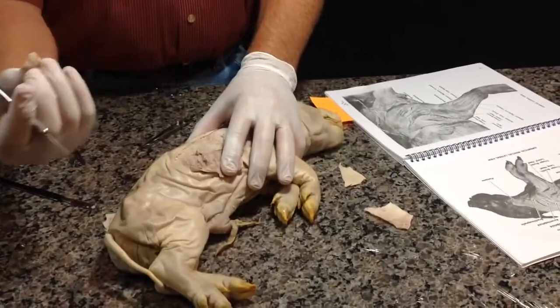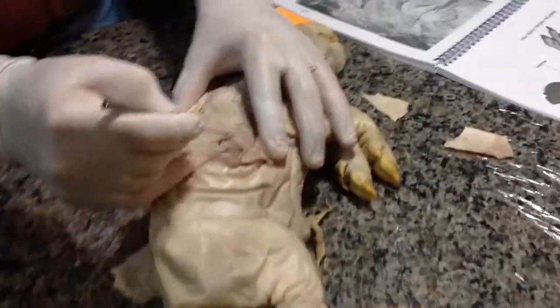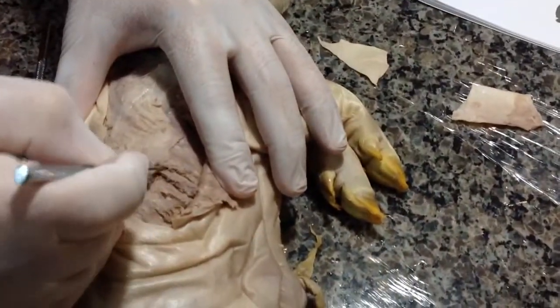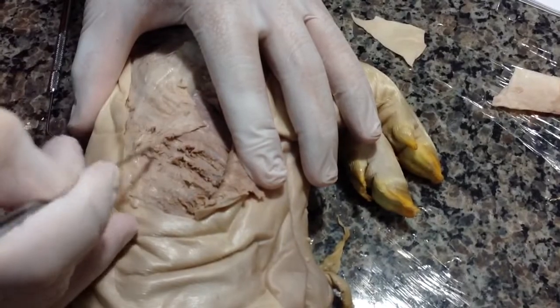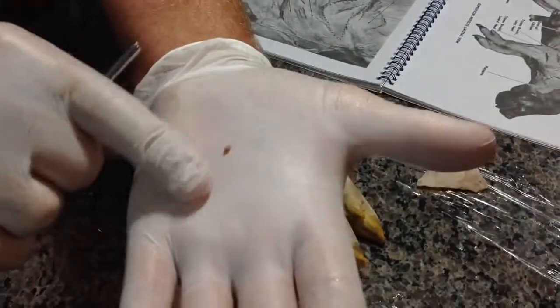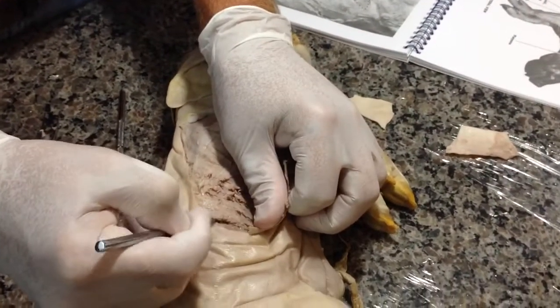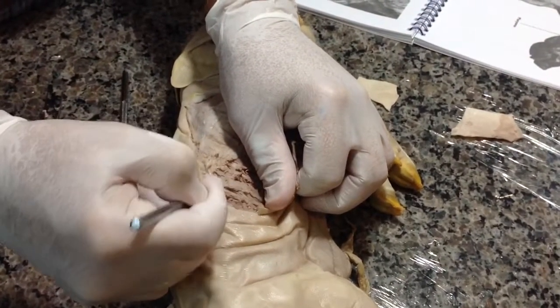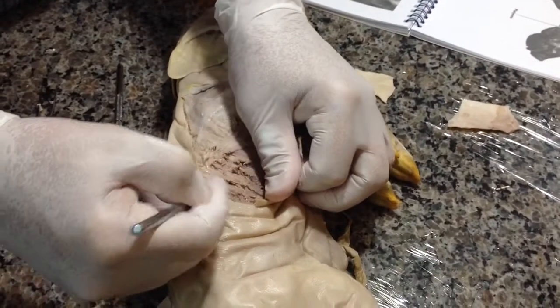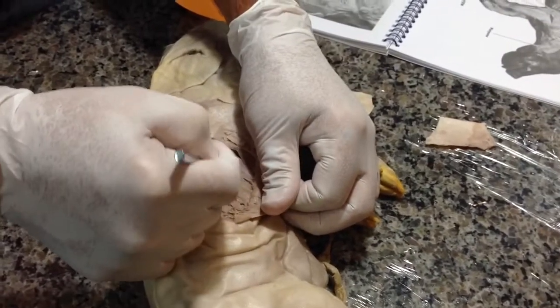So, what looks like a nice smooth muscle. As we begin to scrape it, we see the fibers coming out of there. Whoa! We begin to see all these fibers coming out of this muscle. So now what we have are muscle fibers, a bunch of little bitty fibers. This is kind of interesting, because as we see this muscle, the more I scrape it, the more I'm scraping across the rib cage.